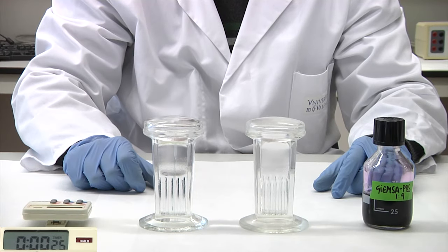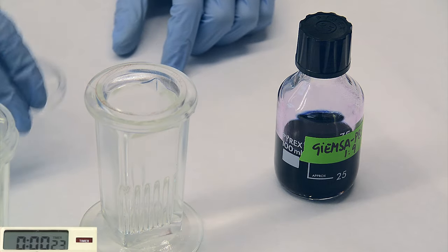After fixation, we immerse the slides in the Giemsa solution for 10 minutes.